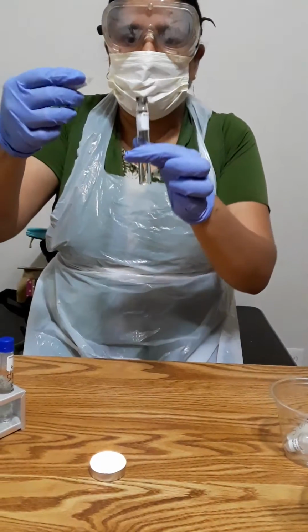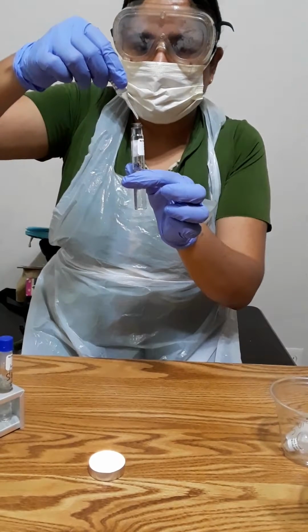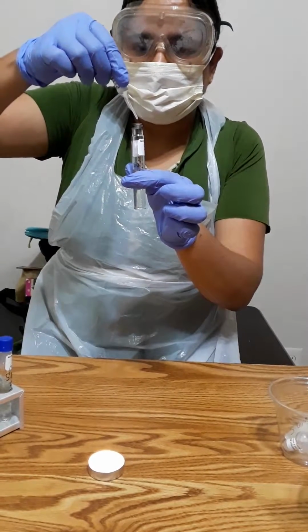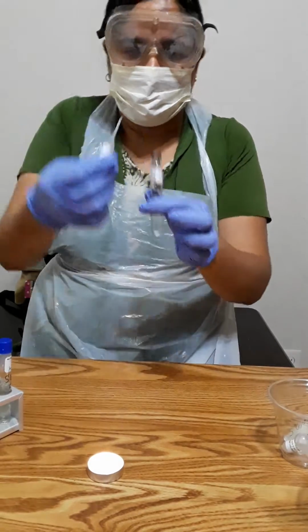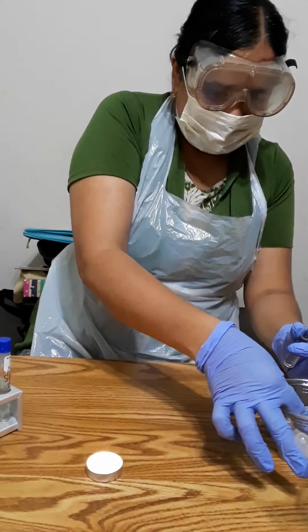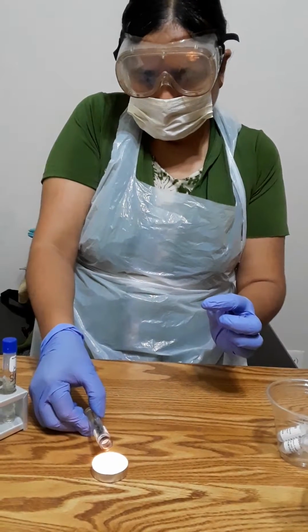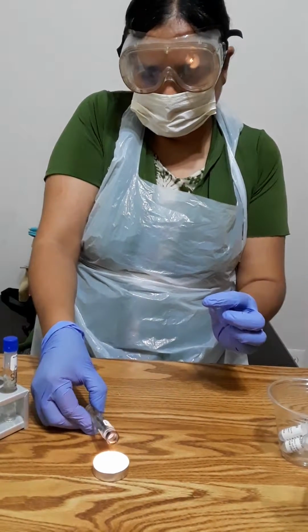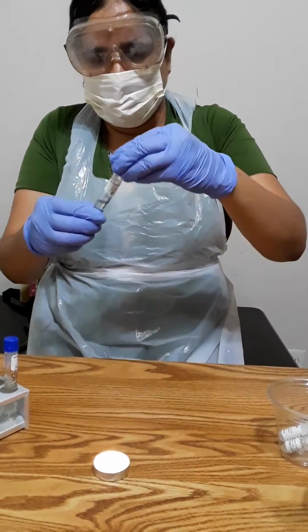I'm just going to put 1 drop here. Okay. And I'm going to sterilize it again. Close the lid.